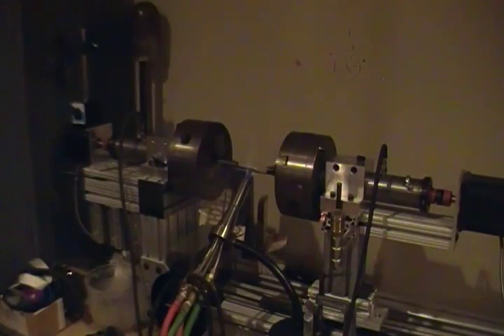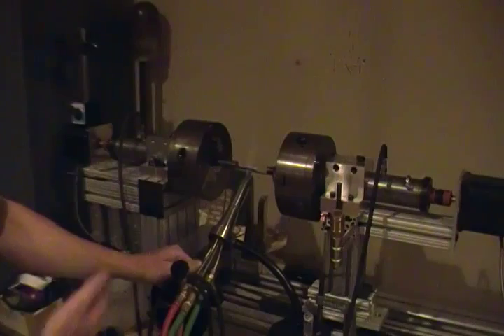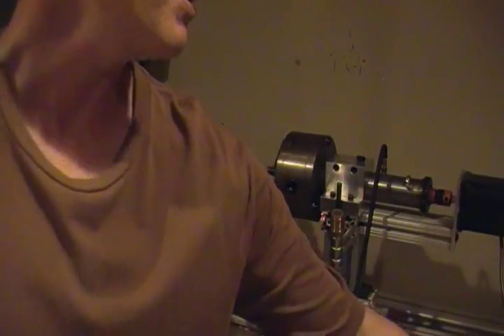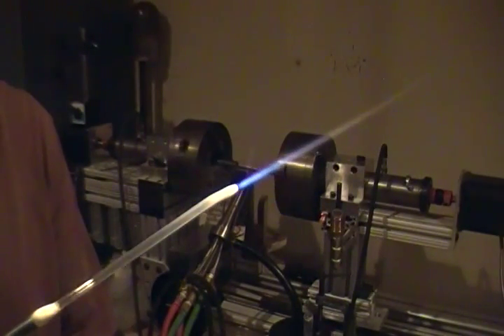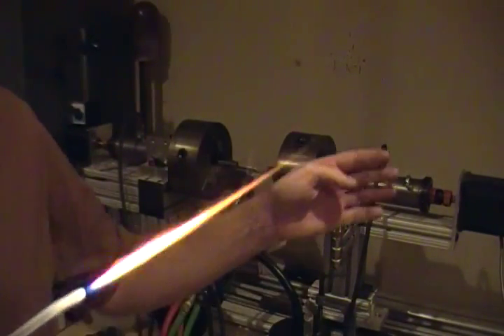We're using the hydrogen torch to get the extreme temperature we need to work the material. It's almost 1,000 degrees hotter than working Pyrex. So here we go. I got the hydrogen flame on right now. It's really hard to see the hydrogen flame. It's almost invisible. And this is a quartz torch here, and I just have hydrogen on right now, no oxygen. It's a very clean, real deep blue flame. And as I add a little oxygen, we can see it really comes out to a sharp, fine, long point.